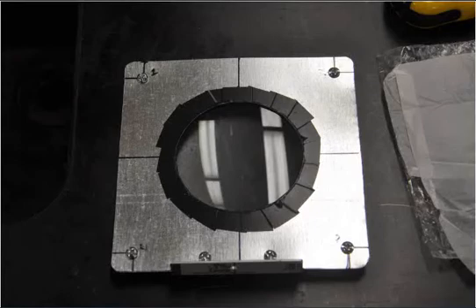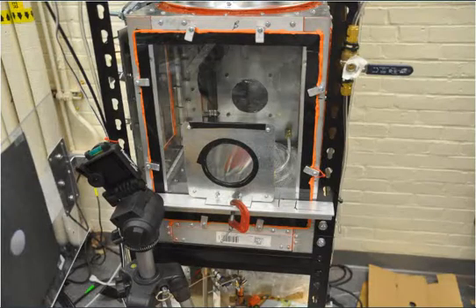You want to put in all your screws before you tighten down the nuts, because since it's such thin steel, it'll actually bend, and it'll be much harder to put in the rest of the bolts, not screws, the bolts, right? No taper. If you tighten down the first one before you put in the last one, it'll be hard to get in the last one. And now that it's made, we can mount it anywhere we want.